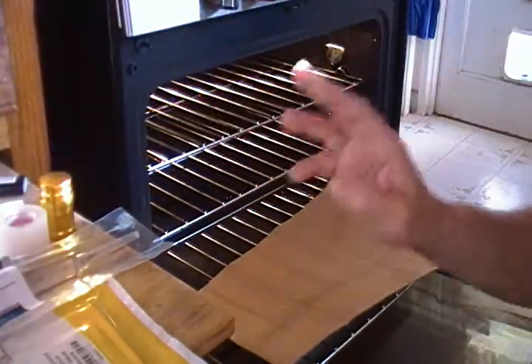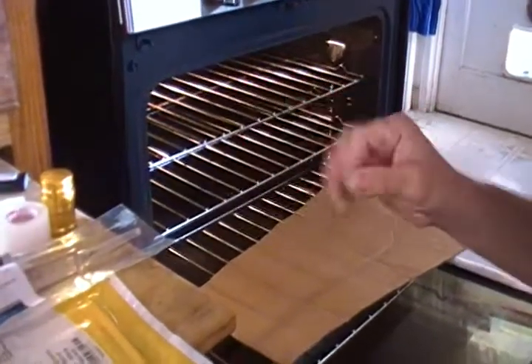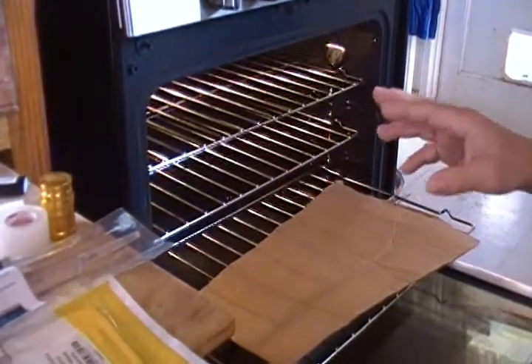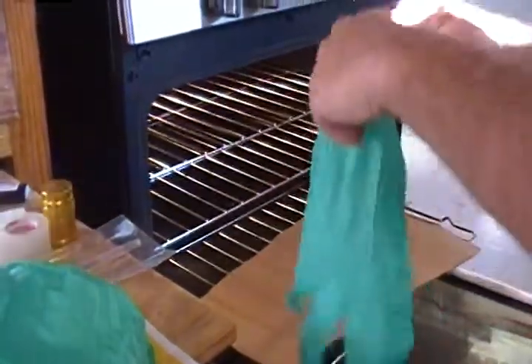I'm going to be doing only four jars today because I don't want to be talking too much while inoculating — it might cause problems. So I'll just let you guys see what I'm doing for the four jars. Let's get our gloves and put them on.